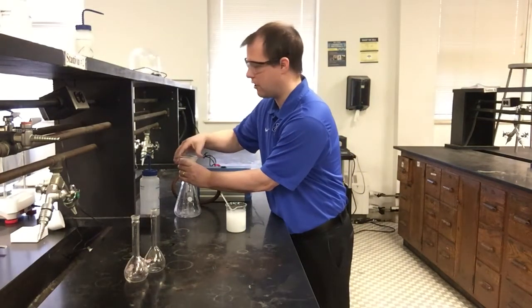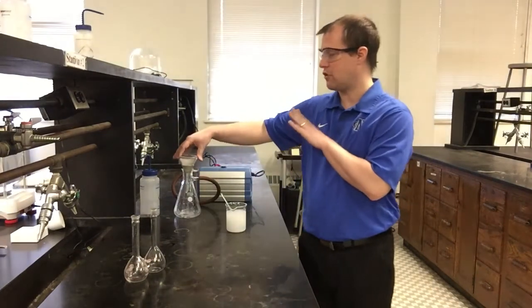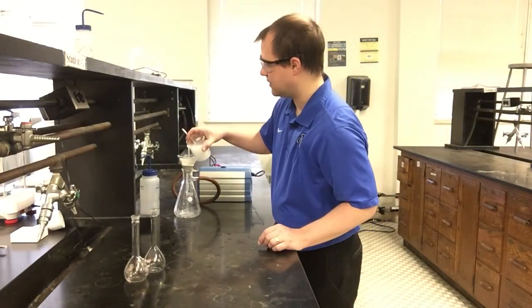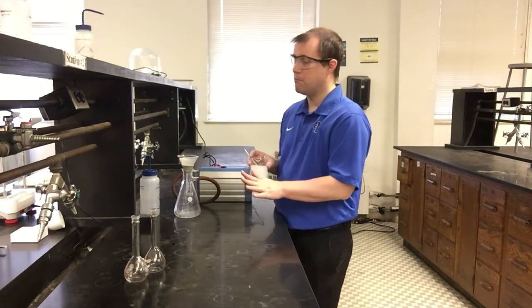Like there, you heard how hard it was for me to pull my hand out. So I'm pulling a good amount of strong vacuum here. That's good. That means this thing will filter very quickly. And what I'm going to do is constantly add my solution. And hopefully what we should see is that what's coming through in the bottom should be mostly clear.